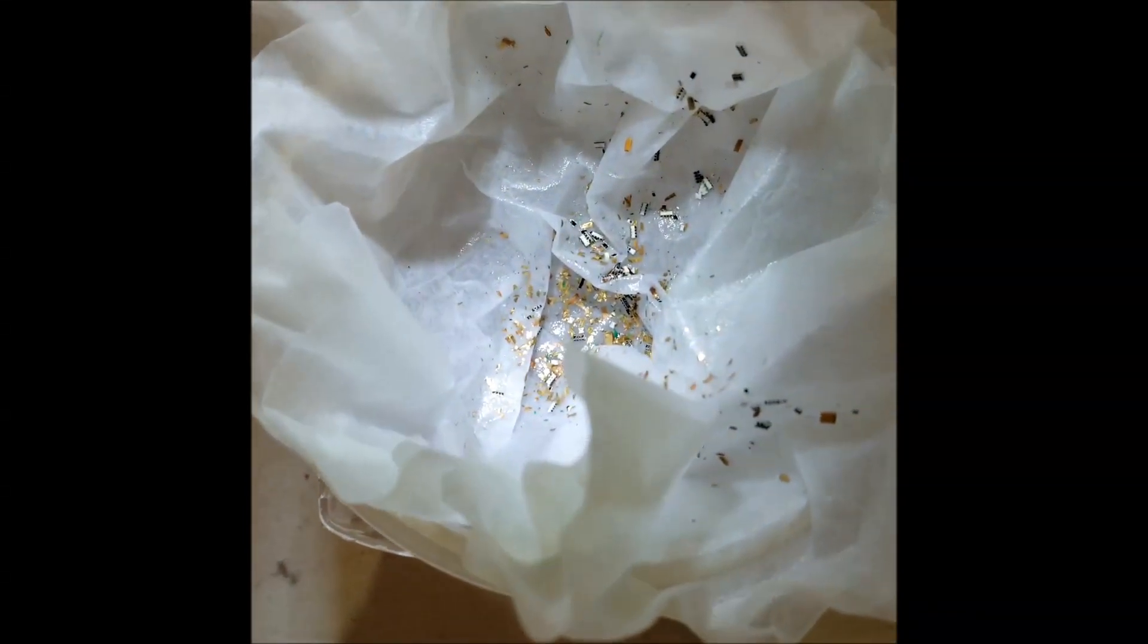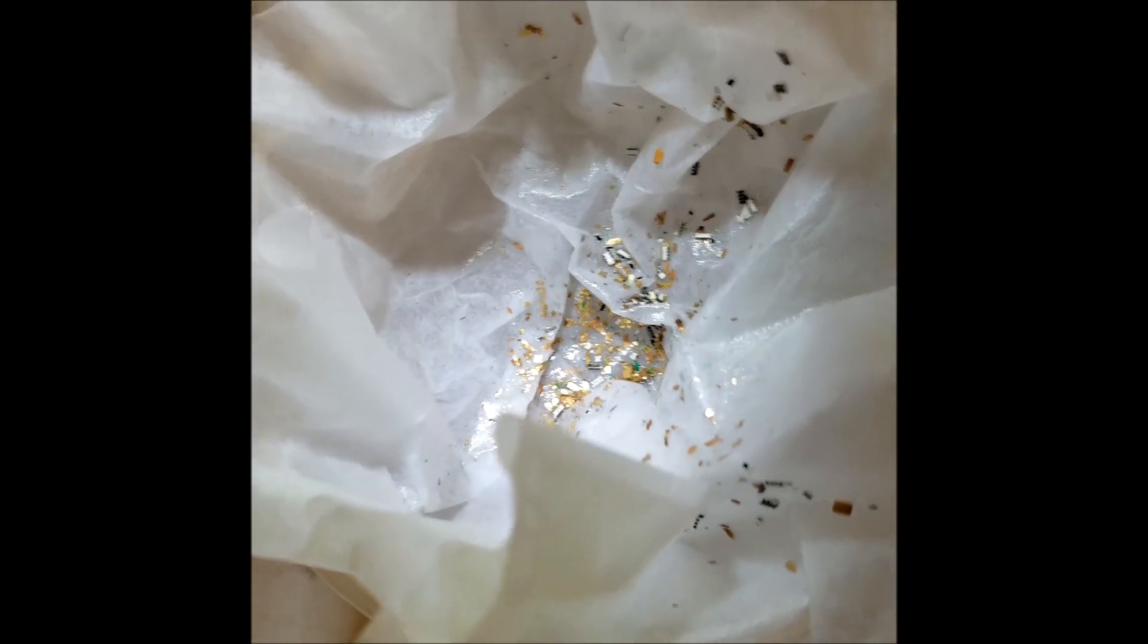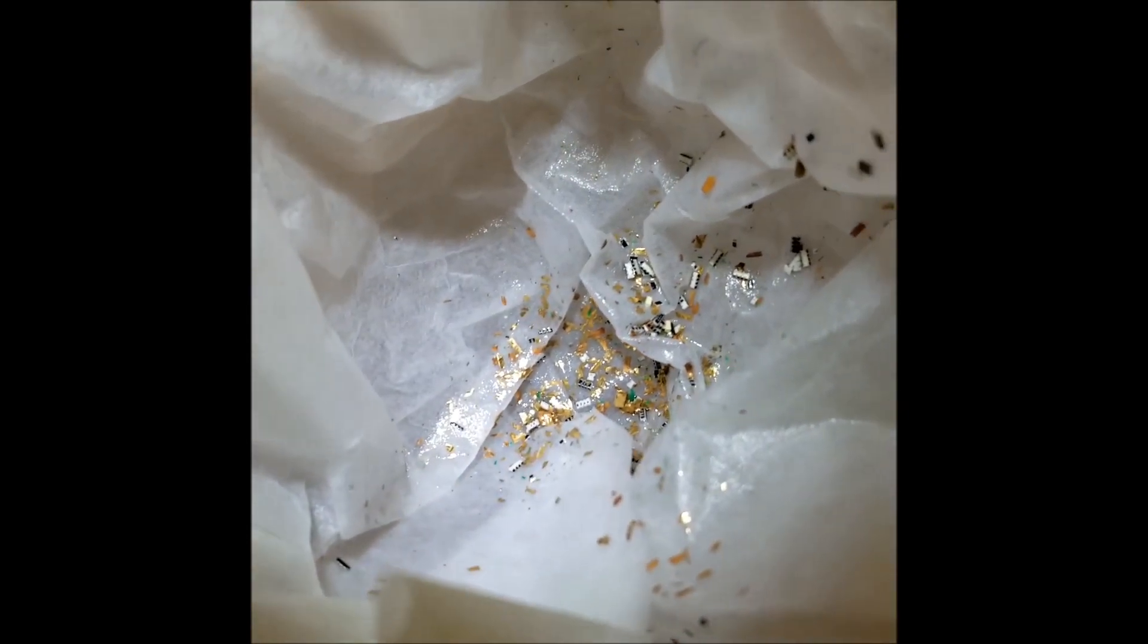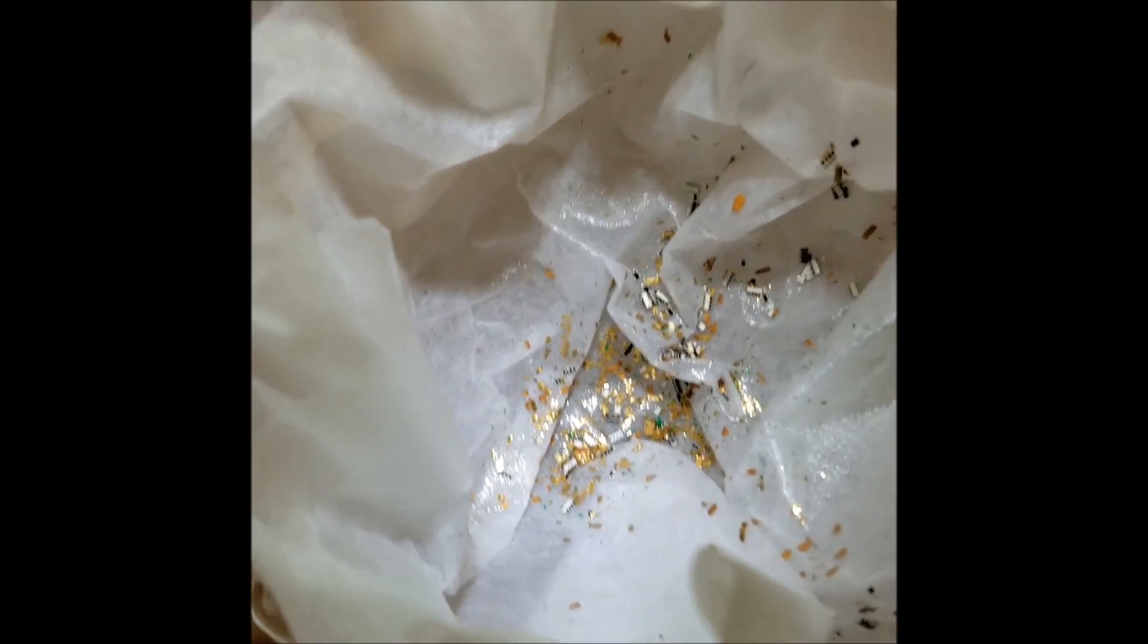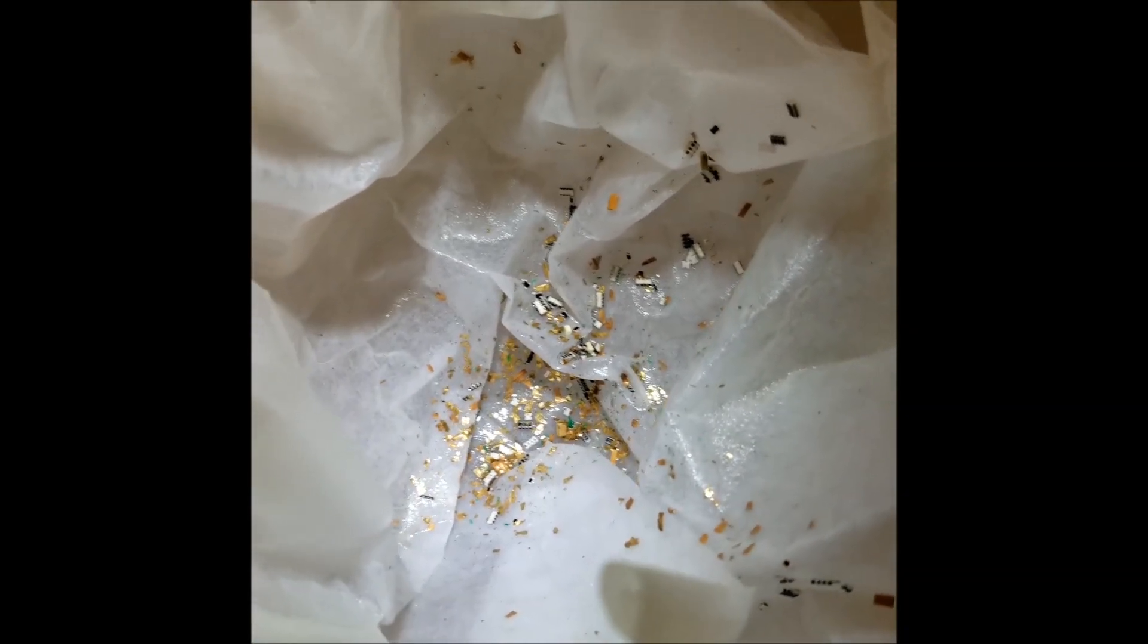I just filtered out the green solution that was bubbling there and just ran it through two pieces of coffee filters and collected the gold flakes, which are now stuck on this coffee filter.